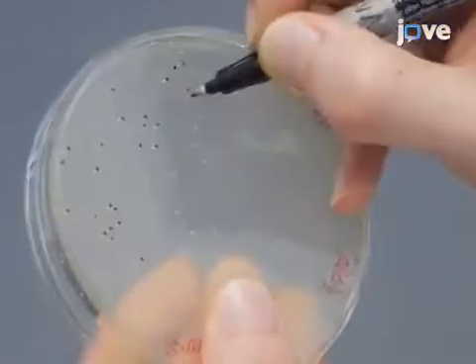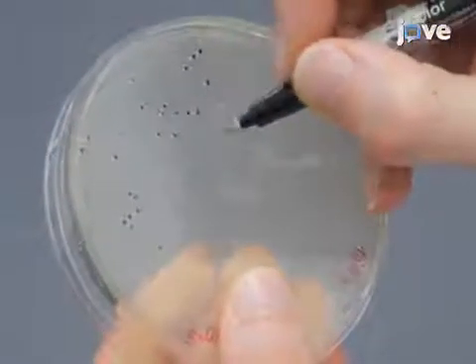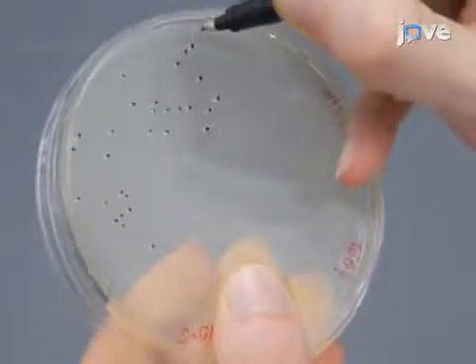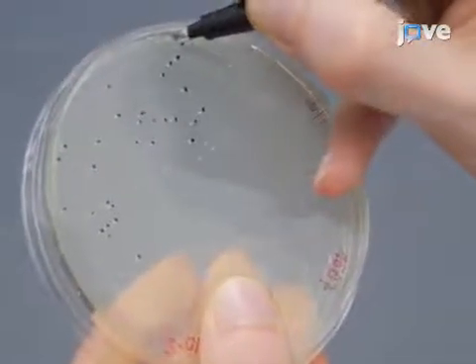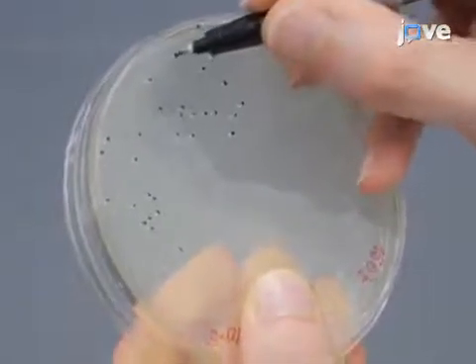For bacterial survival assessment, count live cells just after dilution and after 24 hours, once a week during the first two weeks of bacteria treatment.